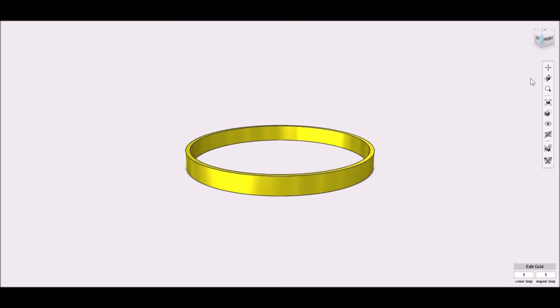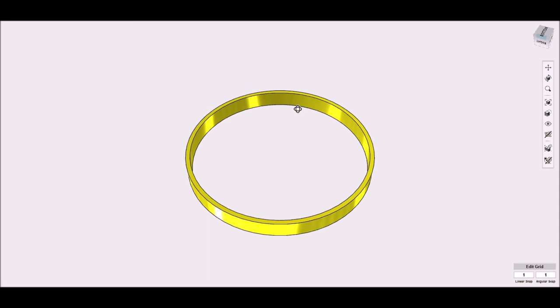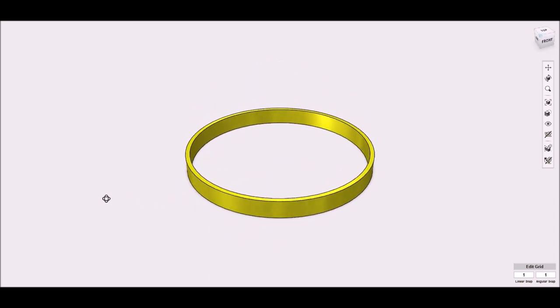This is the retainer ring and spacer that holds the ring light in place. The tolerances on this ring are much smaller than 1 millimeter, which is quite difficult on a 3D printer. It looks simple, but it was actually the toughest one to get right.